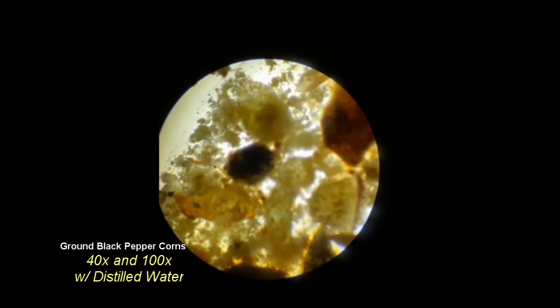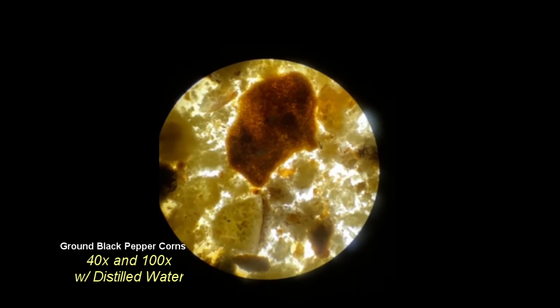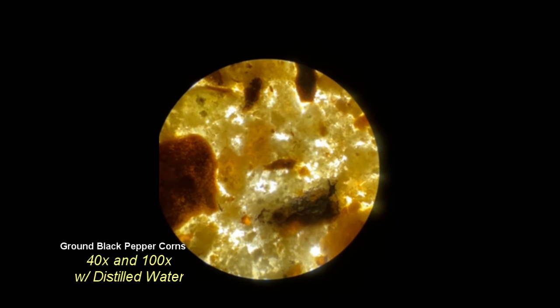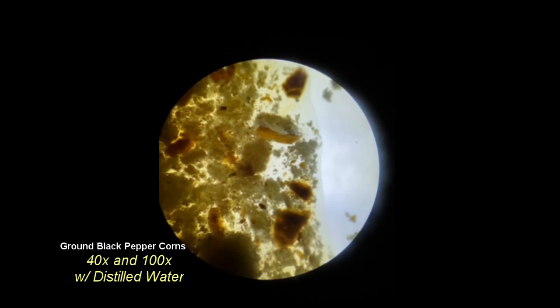Although the water contained no visible large particles, the coloration would likely have either been caused by a soluble component attached to the black peppercorns, or when the pepper was ground with the mortar and pestle, some of the particles became so fine that no amount of filtration would sufficiently clear the water of color.